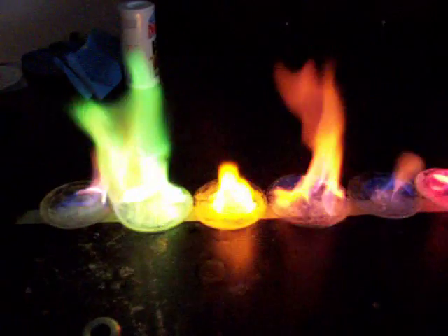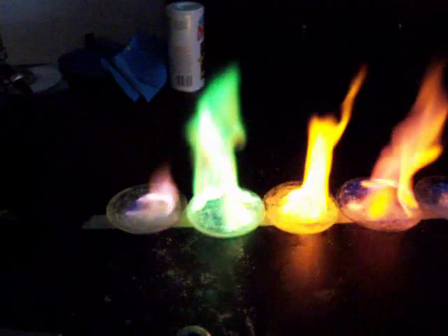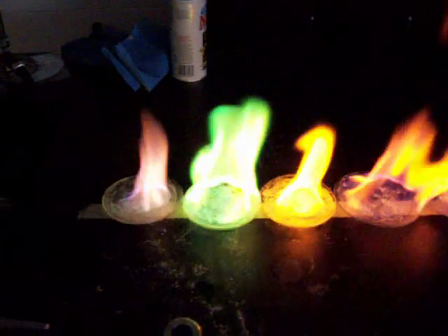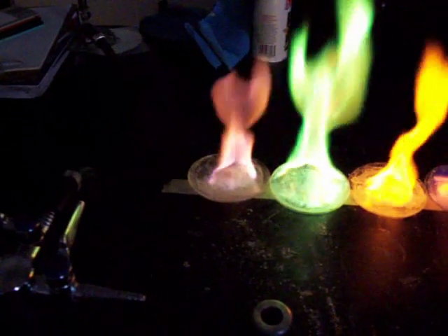Next we have sodium giving us a characteristic yellow flame. Then we have copper with its green color, and finally potassium with the purple or lilac shade.